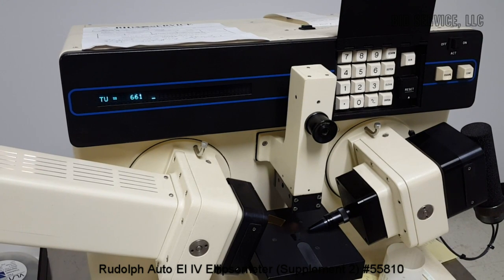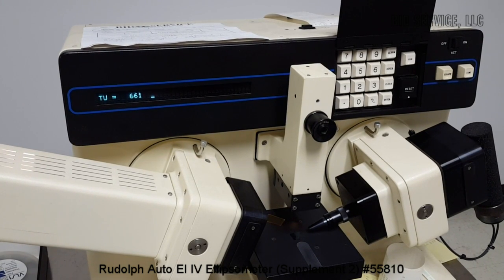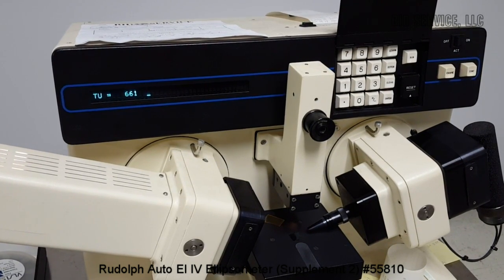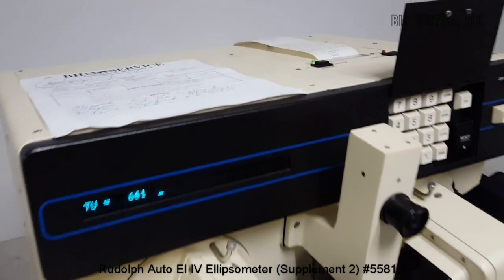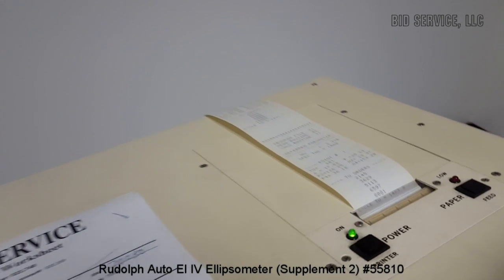So now film thickness is pretty close to what it was with the other program as well. It is 661 angstroms or 66 nanometers.